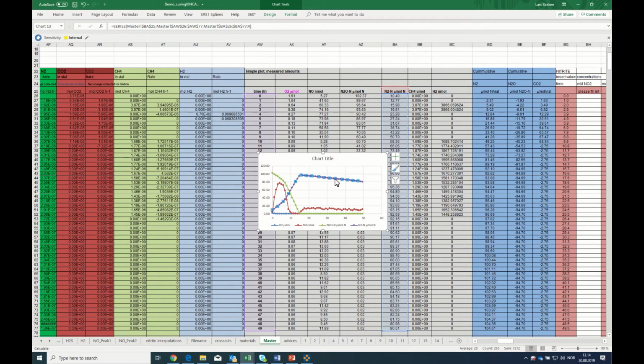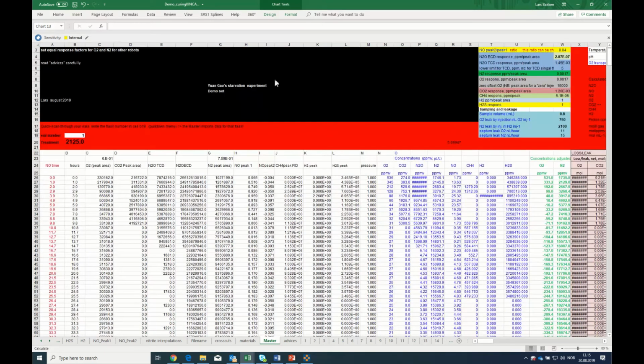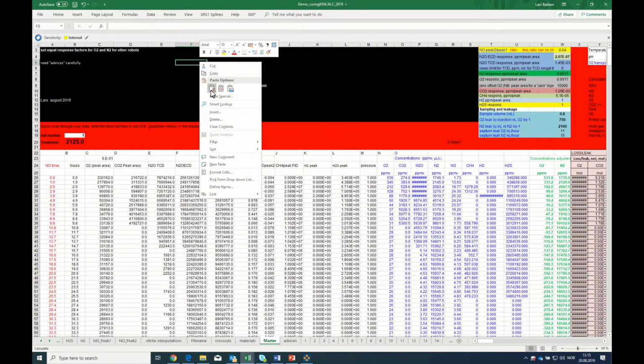So we click on this one again, and we drag this over to have the accumulated N2, and now you see that they actually produce a certain amount of N2 after depleting the N2O and the nitrite. So this will be your inspection window, and you can copy this one and move to the left here and paste it in here.